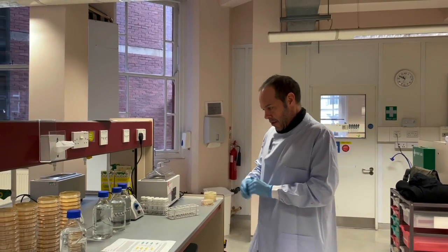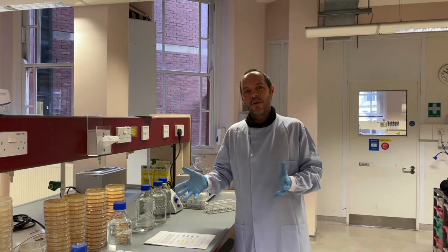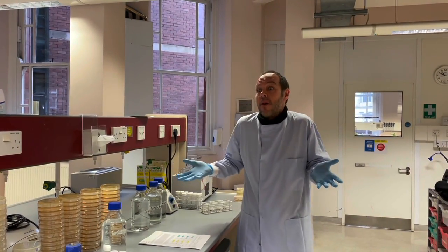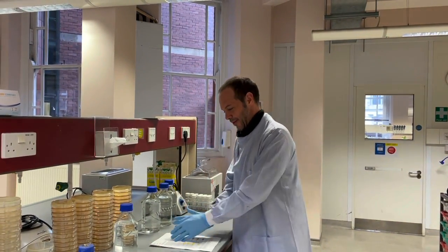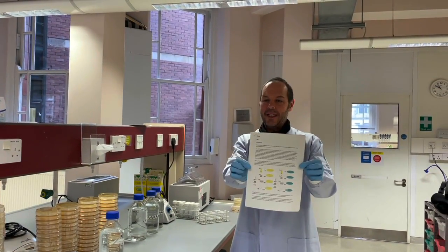Right, so I'm just going to go through and do the protocols, what I had hoped that you would be doing. So if we were meeting to do the lab session, you'd have a written protocol like this, incredibly detailed.